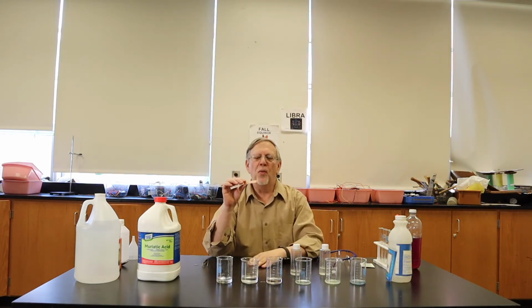We have over here in these 6 beakers, 6 different liquids. We have in beaker number 1 hydrochloric acid, a very strong acid. Beaker number 2 contains vinegar, a rather weak acid. Beaker number 3 is ordinary water. Beaker 4 contains a mixture of baking soda with some water. Beaker number 5 is something nicknamed lime water. Its actual name is calcium hydroxide.